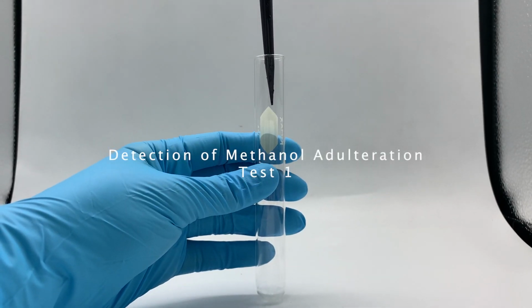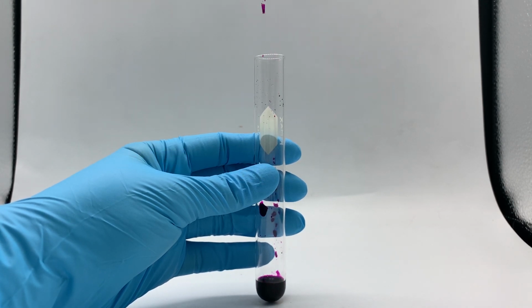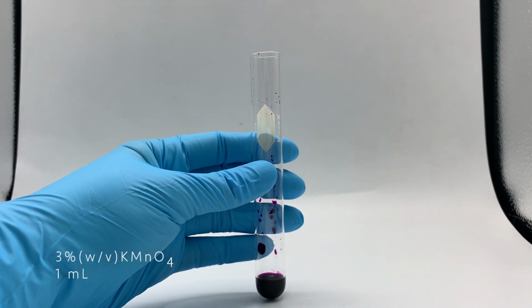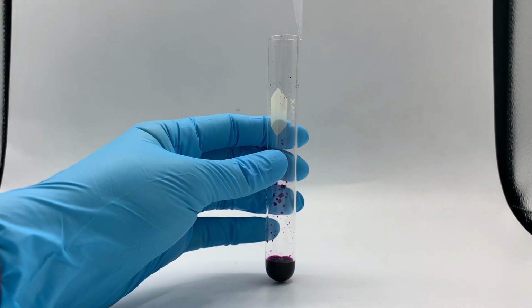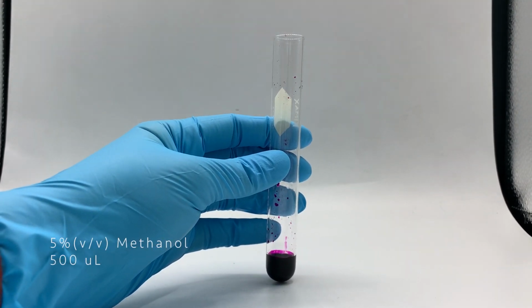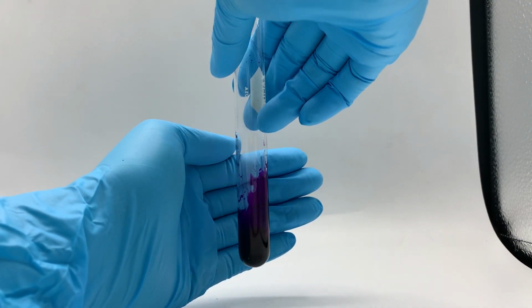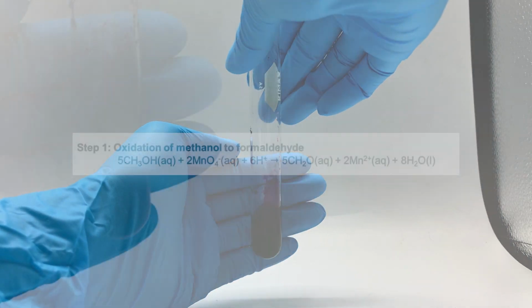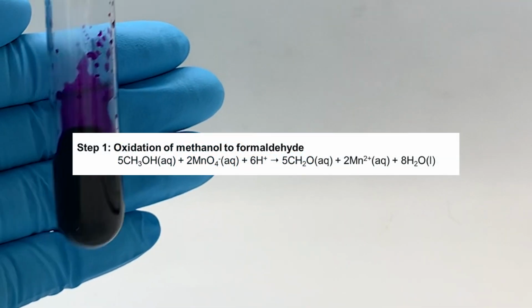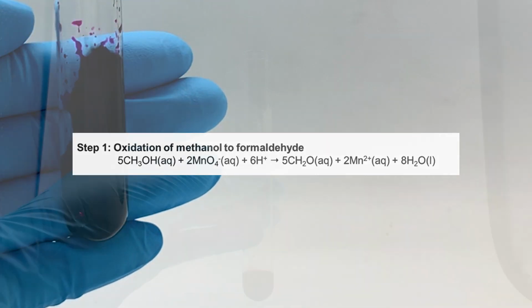Basically, test 1 is started as the first step by adding 1 ml of acidic potassium permanganate in the reaction vial. Then, add 0.5 ml of 10-fold diluted sample in the vial and swirl for 5 minutes. In this step, called the oxidation reaction, permanganate is going to oxidize methanol to formaldehyde.